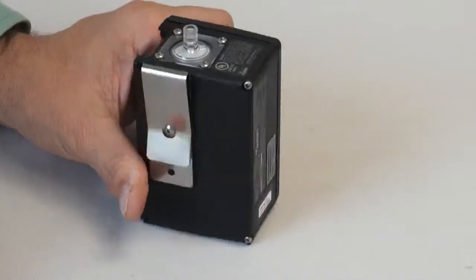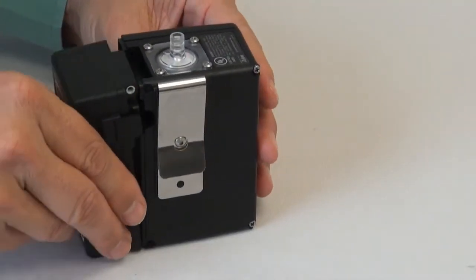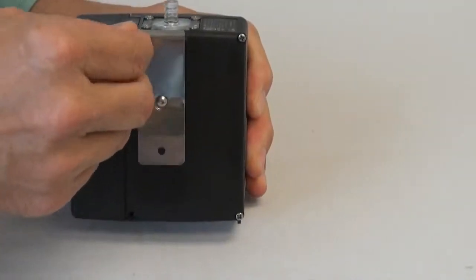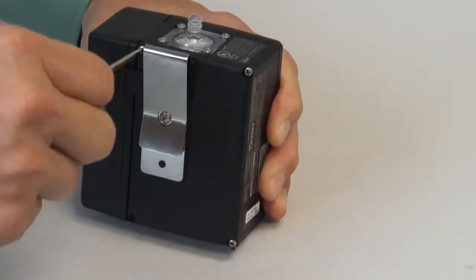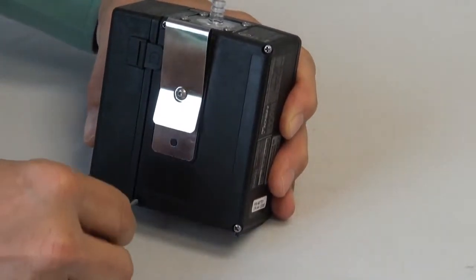To reassemble the battery pack, make sure the O-ring is in place and not damaged. Slide the pack into the case and firmly press together. Insert the 2 screws and tighten. For a more detailed listing of parts, please refer to the Escort ELF manual.